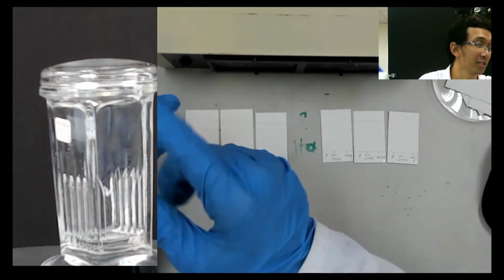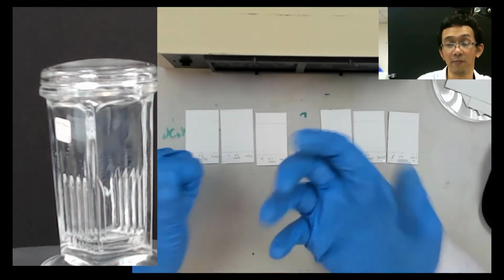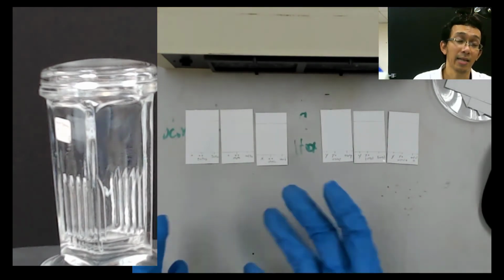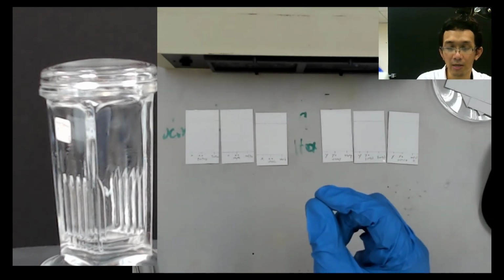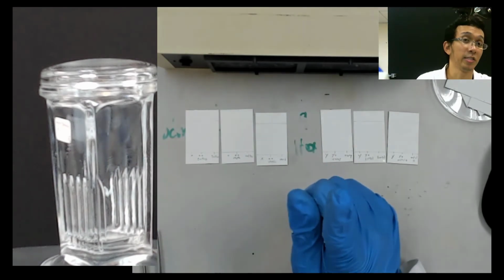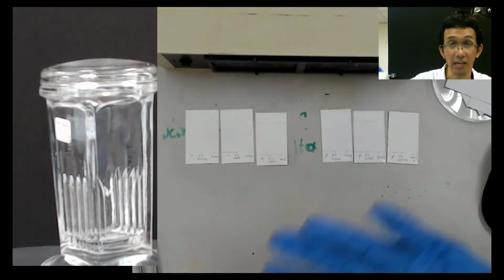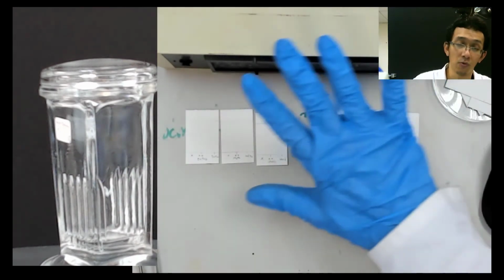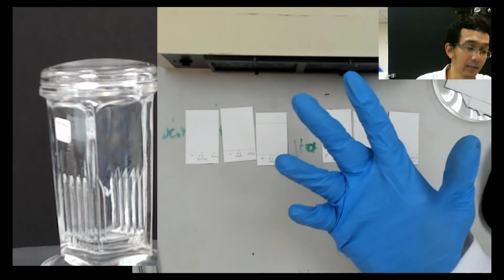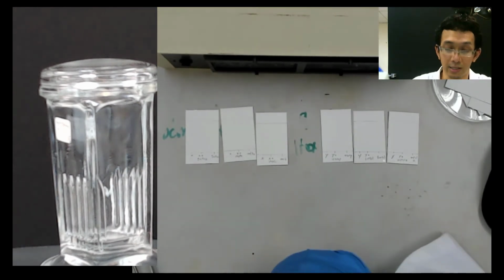The thing is that when you use staining, it is destructive. After you stain, if you want to use that sample again, you cannot, because the stain will complex with your compound. So it's destructive in nature. UV is non-destructive, meaning you just shine the light, and after you close the UV, you can recover the compound. So that's one thing, destructive or non-destructive.